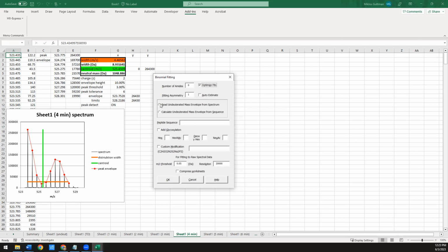Then down here, it wants to know whether you want to read in the undeuterated mass envelope from the undeuterated mass spectra, or whether you want it to calculate it from the sequence. I always calculate it from the sequence because you don't know whether your undeuterated spectra is really clean or not. So in this case, I know that this is our peptide sequence for angiotensin. I'm going to insert it there. I'm going to say calculate it from the sequence.